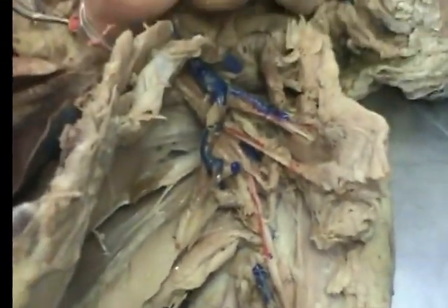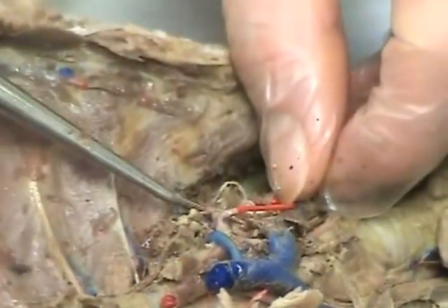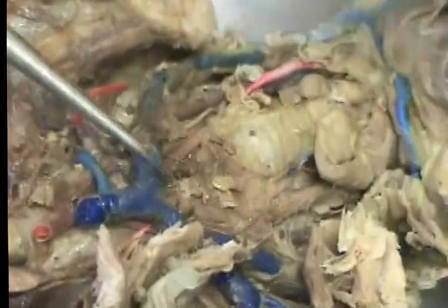This is the brachiocephalic artery coming off the heart, and this is the left subclavian artery. And then this branches funny over to the arm. That's the right subclavian artery. Once you get up to the throat, these are called the carotid arteries. And your thyroid gland, oh, there it is right there, the red one going to the thyroid. It's really small on yours, is the cranial thyroid artery.